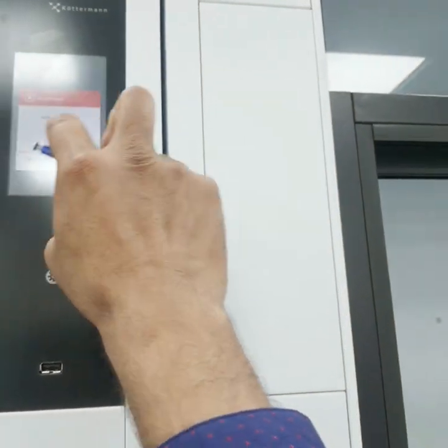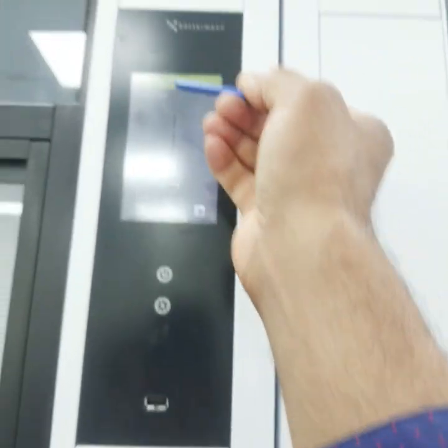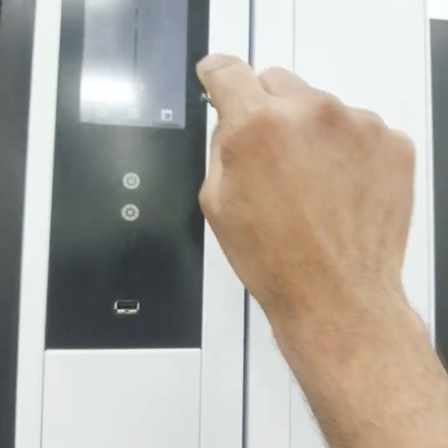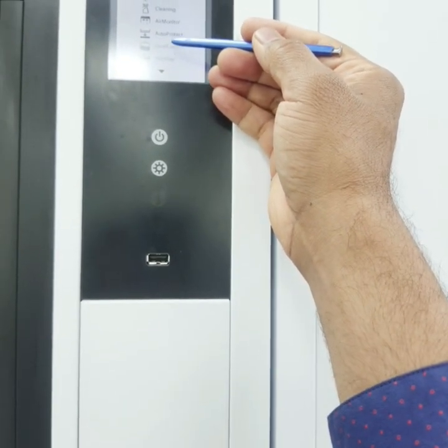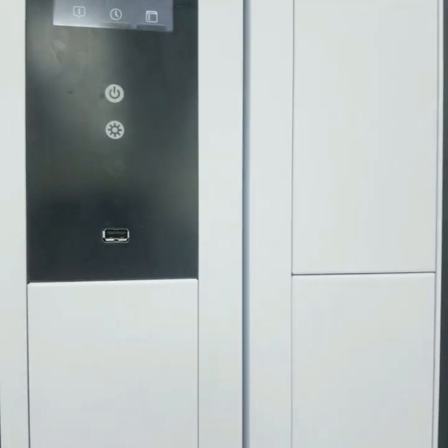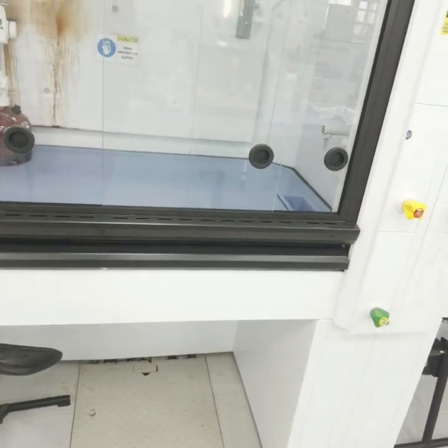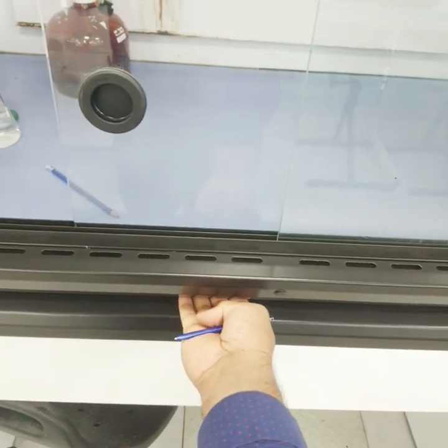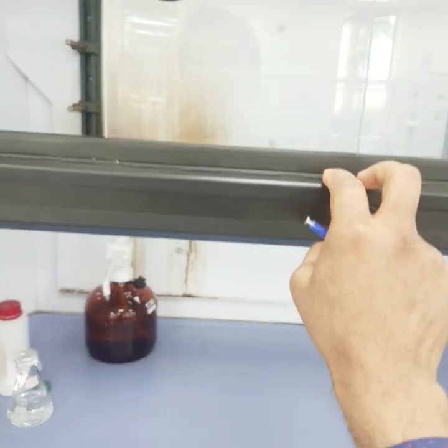In front of the fume hood, the controls are touch-operated. You can see the airflow is around 320 cubic meters per hour. There are certain functions: contact cleaning, air monitor, auto protect, and level control, along with top menus. In front there is also a door.